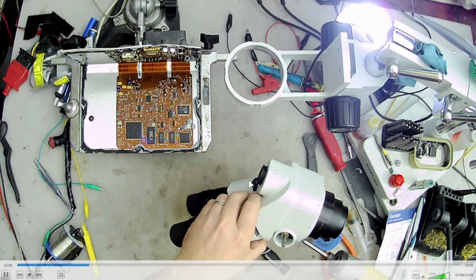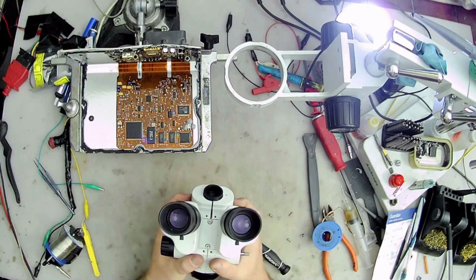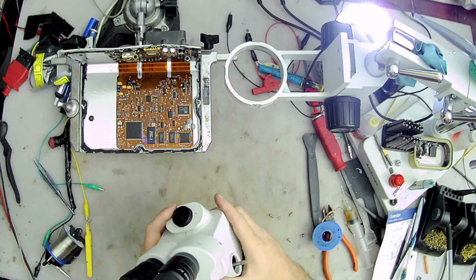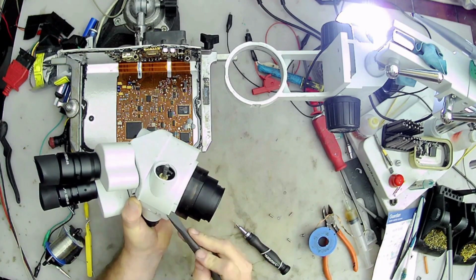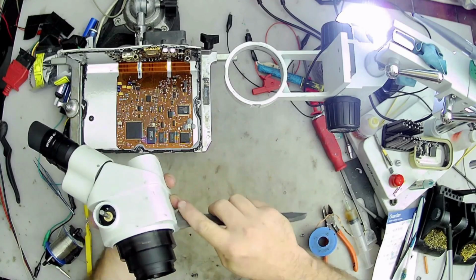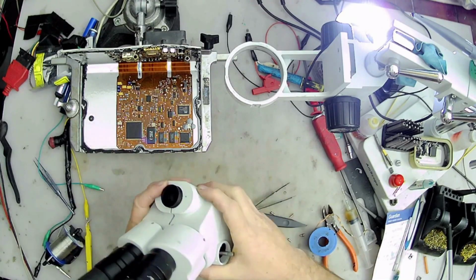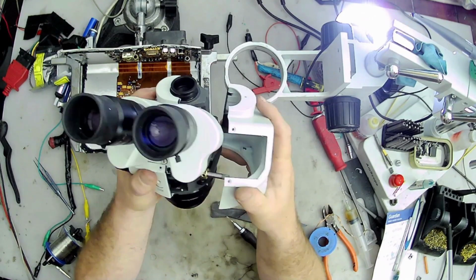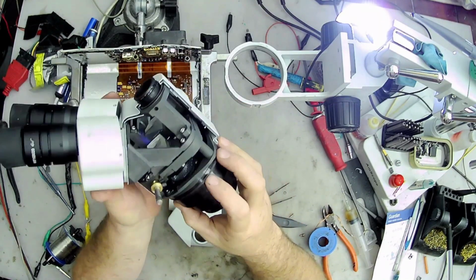So we can figure out what's going on with this. Don't need to mess with those other screws. First let's just get the case off of it to see what we're working with. And even without the screw, it's like a press fit. I've never been in one of these before, so I was being a little bit more cautious. I didn't really want to dig in there with tools, but there we go.